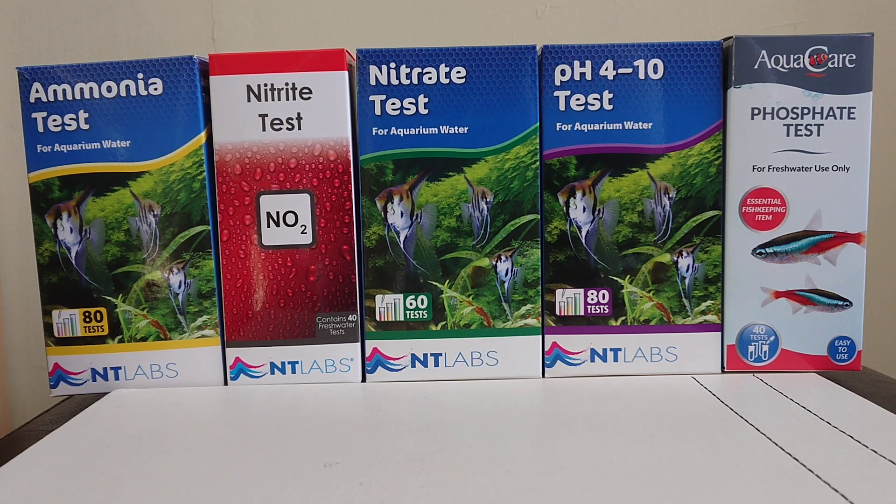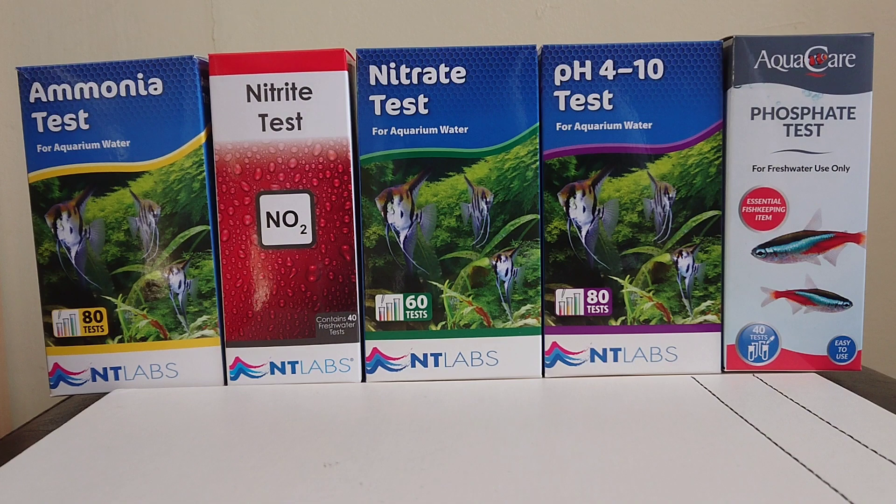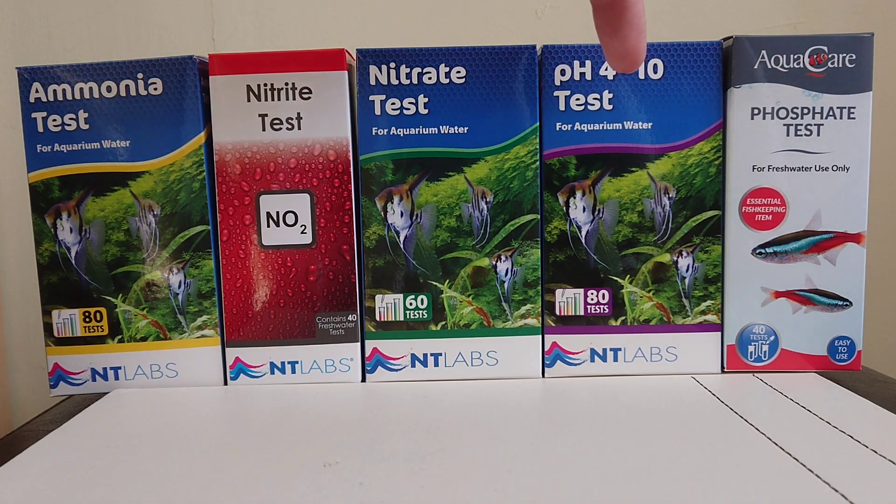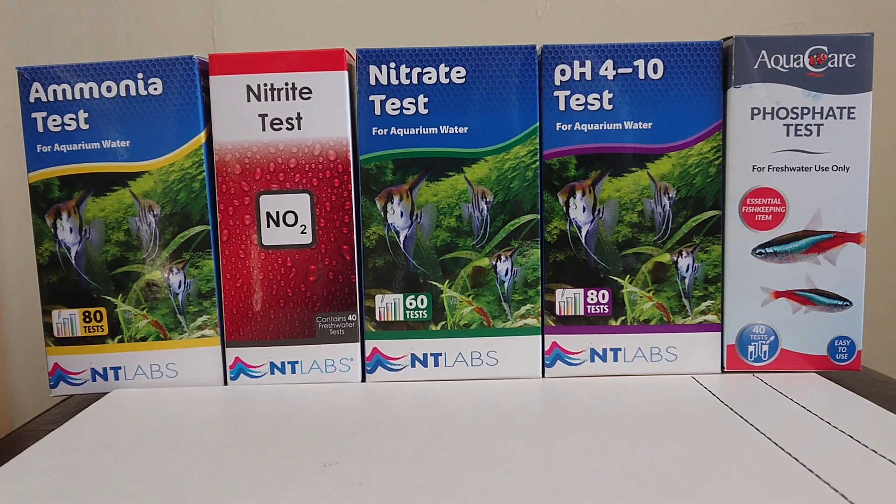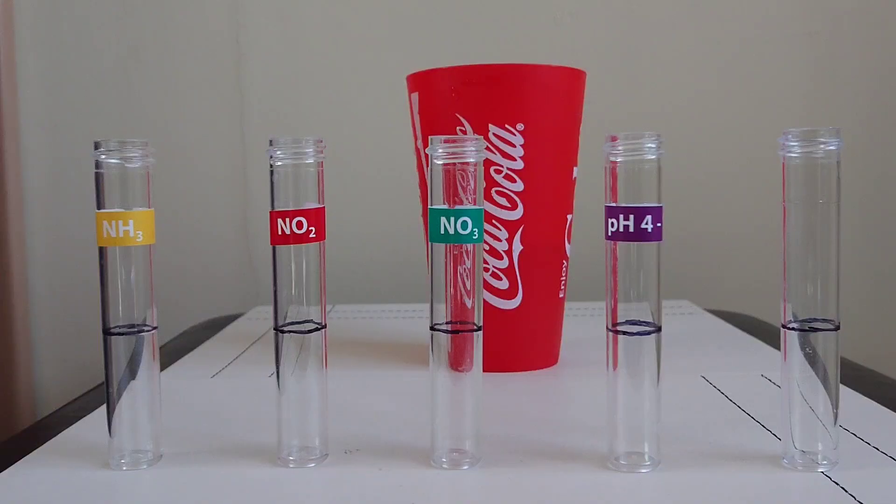Okay, so in this video we're going to be testing the water in our aquarium. These are the test kits which I own: I have ammonia, nitrite, nitrate, pH, and phosphate. So we've got our tubes already.